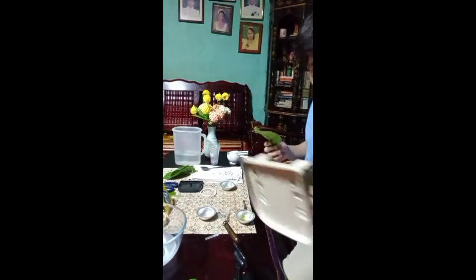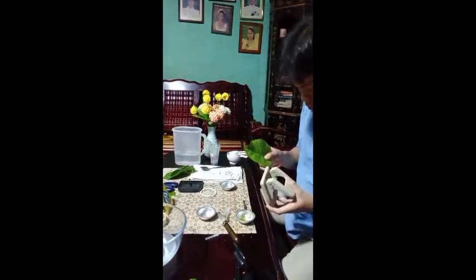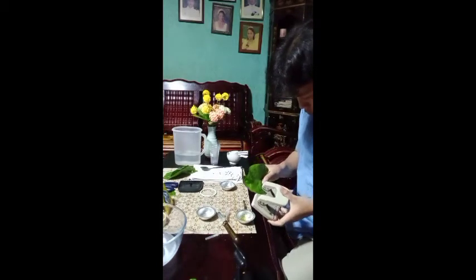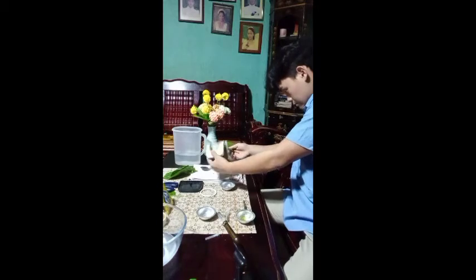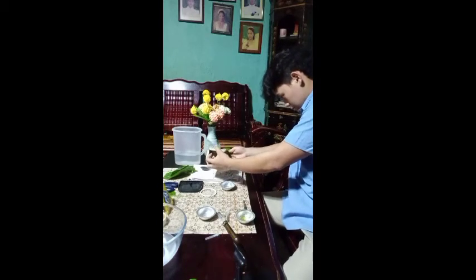Avoid creating foam. Use the metal hole puncher to cut 20 leaf discs from the leaves of fresh peanut or alugbati. Avoid punching through the large leaf veins. Make sure all the discs are the same size and complete circles.